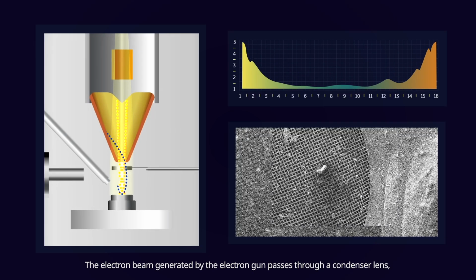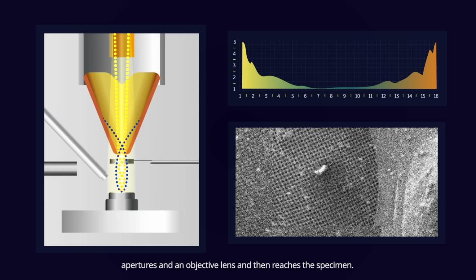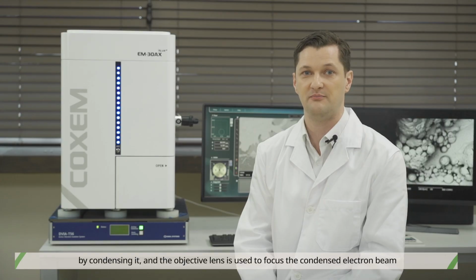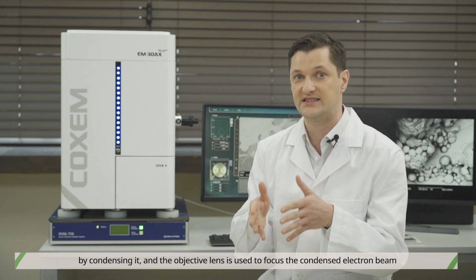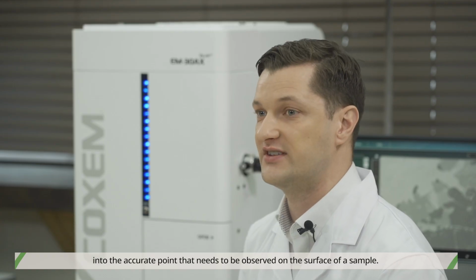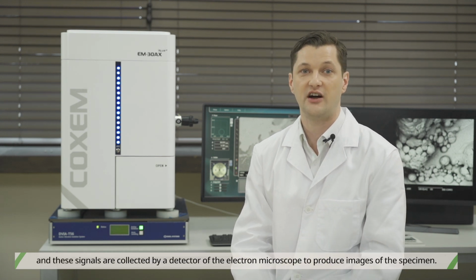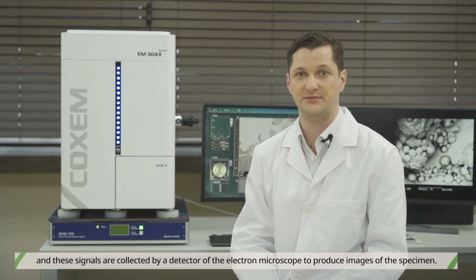The electron beam generated by the electron gun passes through a condenser lens, apertures, and an objective lens, and then reaches the specimen. The two condenser lenses reduce the size of the electron beam by condensing it, and the objective lens is used to focus the condensed electron beam into the accurate point that needs to be observed on the surface of a sample. When the electron beam finally hits the specimen, various signals are produced, and these signals are collected by a detector of the electron microscope to produce images of the specimen.